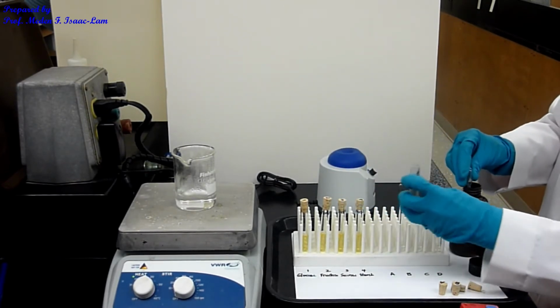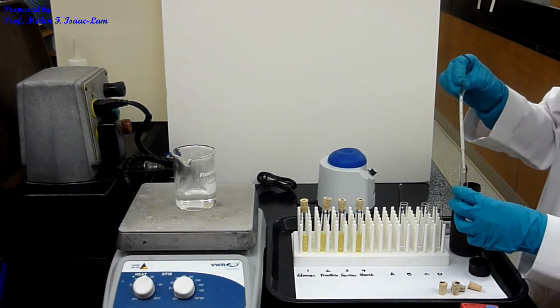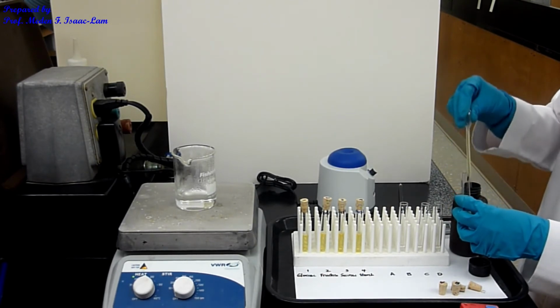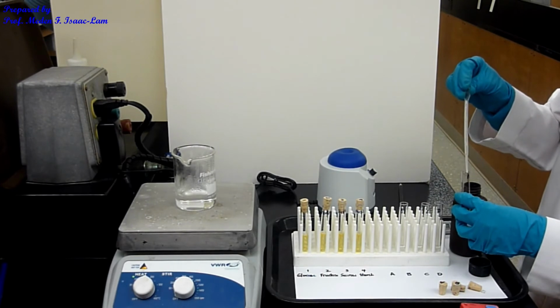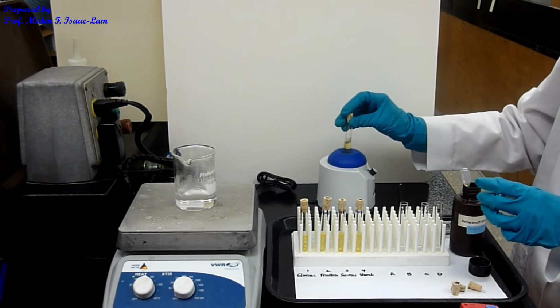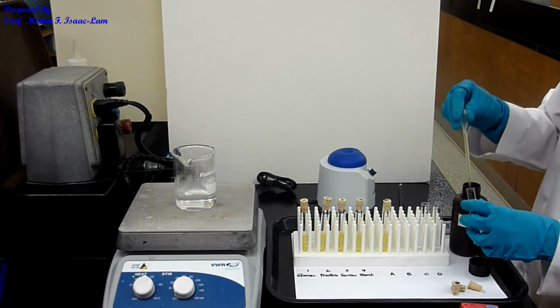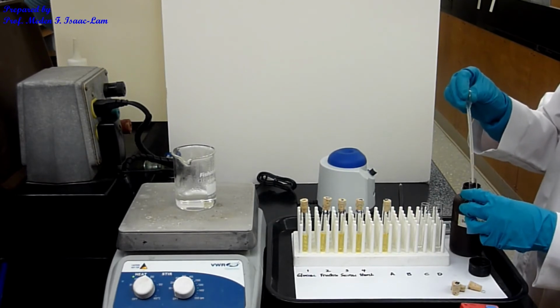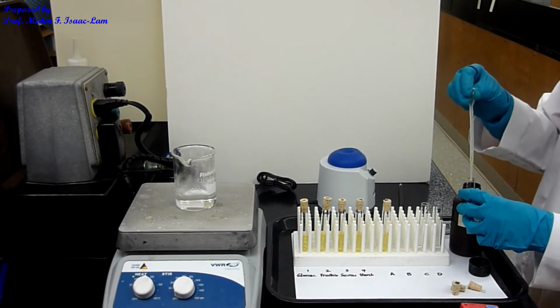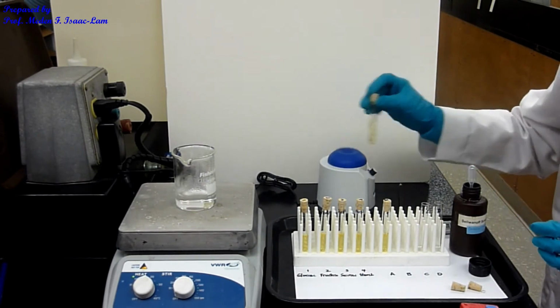I'm not doing all the unknowns, so this is unknown A. Again, 2 ml. So that's A. And then B. Again, you're responsible only for the unknown assigned to you. Okay, so that's B, right?